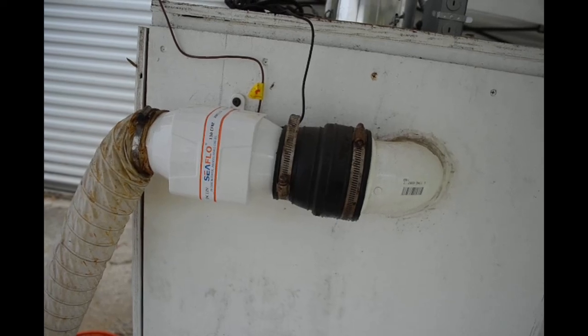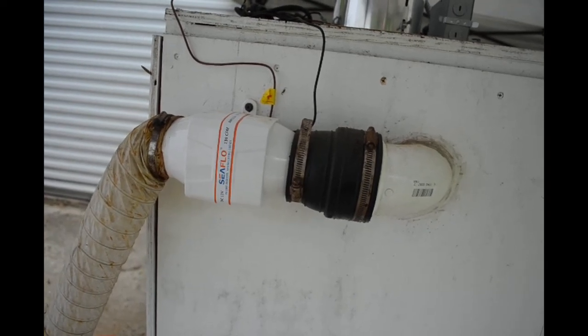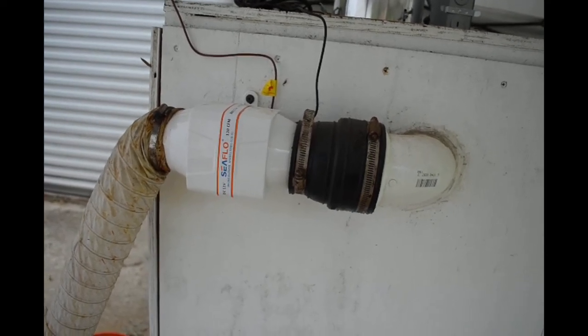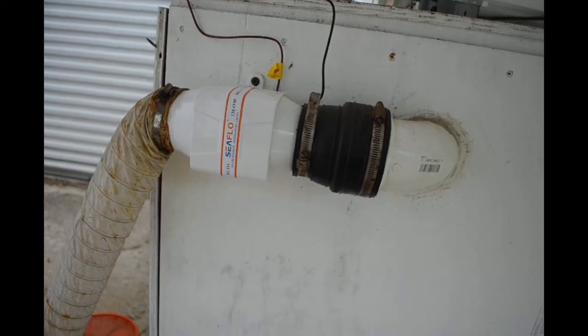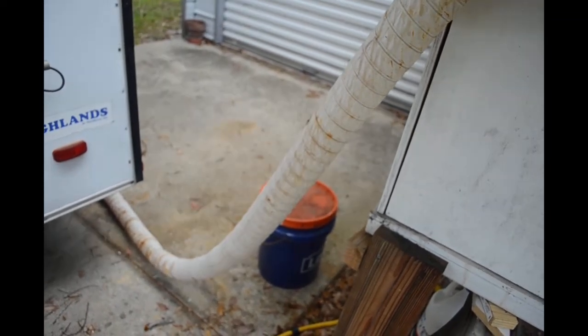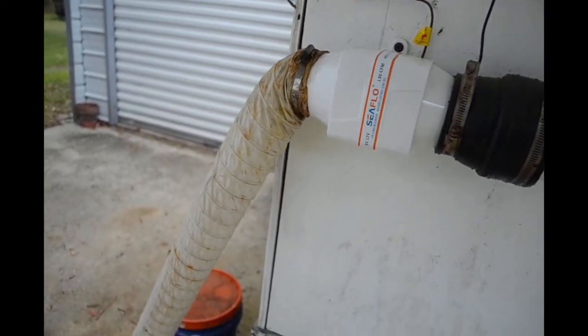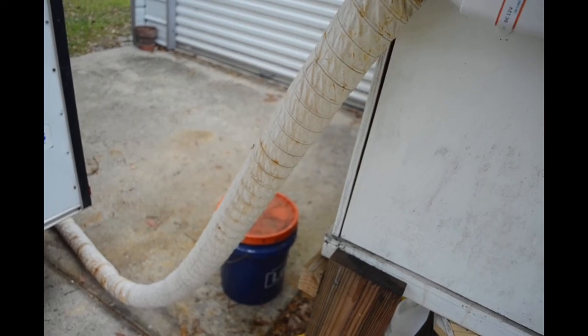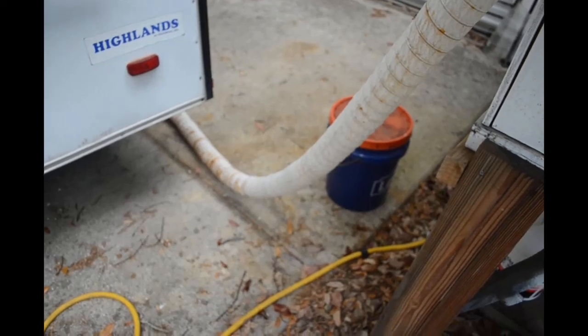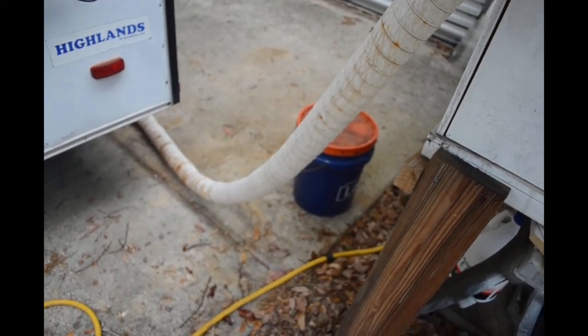They're nice and quiet when they're new. You can tell when they're on their way out when they start getting really loud and rattly. They give you a warning before they fail, which is also nice. When they fail, they just stop running. They don't explode like the bathroom fan did that I had in there before.